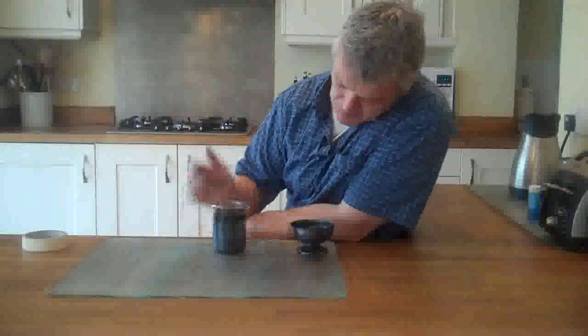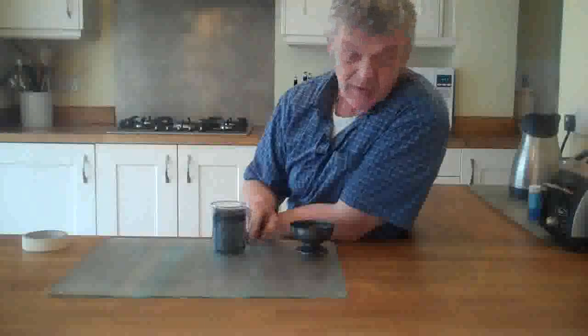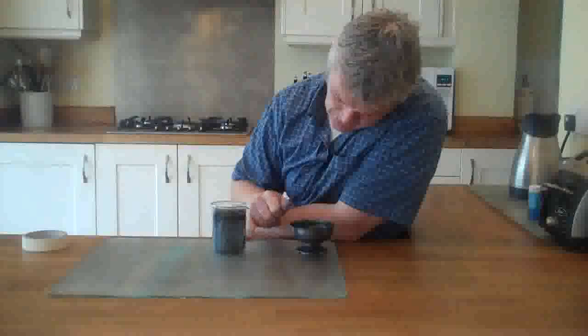Okay, so after half an hour, that's what you get. You can see that the graphene oxide has been reduced back to this black graphene, and most of it's floating at the top because of the hydrogen content. And if you look on the top, it's very silvery and graphite-like. And this material here is a greenish colour.